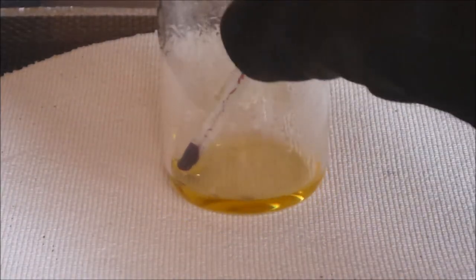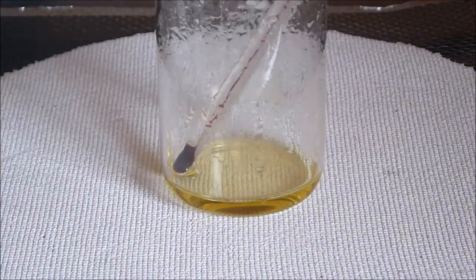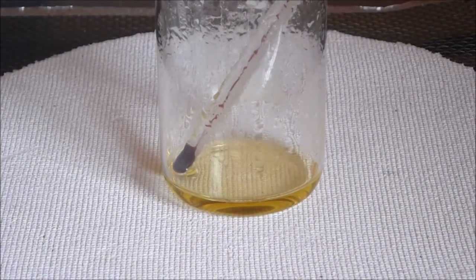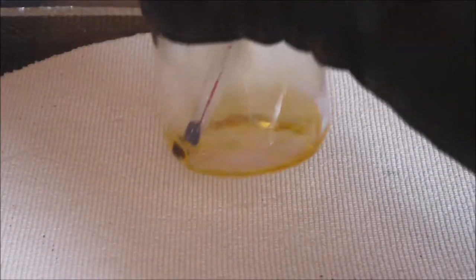Let's have a look. There's still a little bit remaining there, but you can see our solution has gone the nice yellow that you would expect for gold. So far so good.